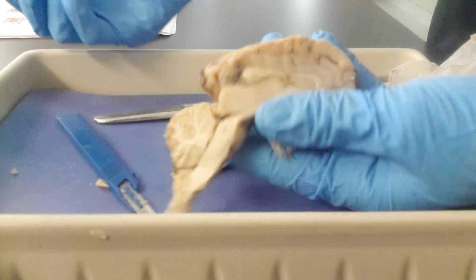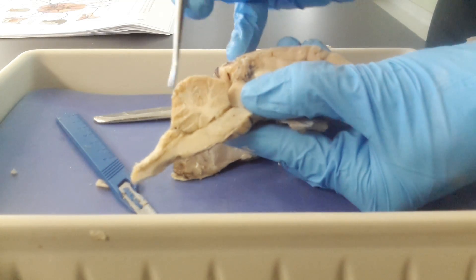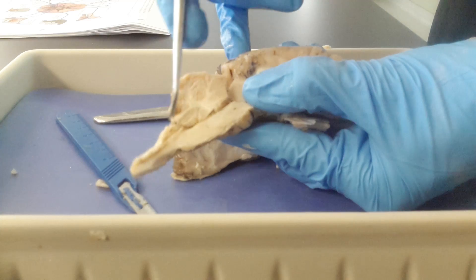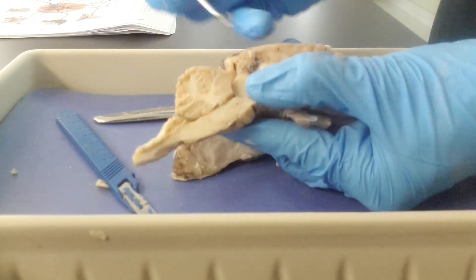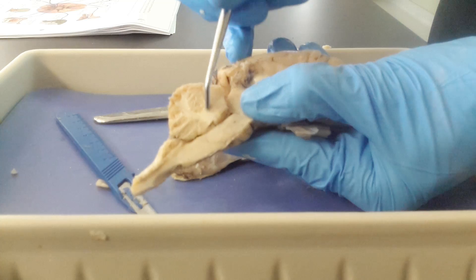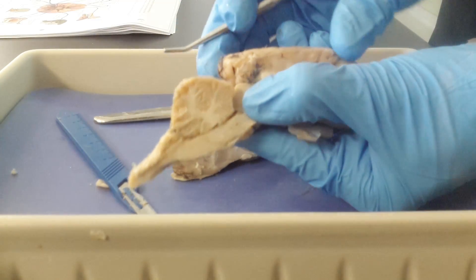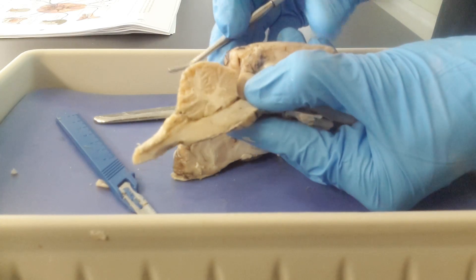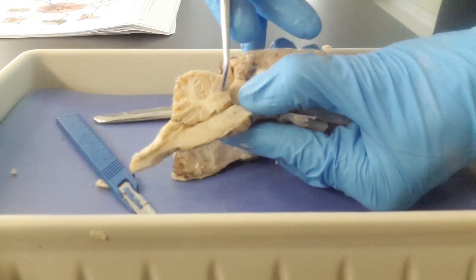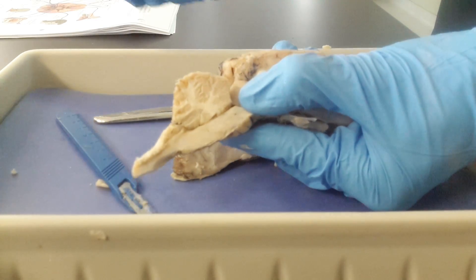Looking at the brain like this, the first thing you notice when looking at the cerebellum is this white matter that stretches and branches out all around the cerebellum. These white lines look like a tree, so they're appropriately named the arbor vitae — the tree of life. That's just the white matter or axons that branch out to the outer gray matter of the cerebellum.